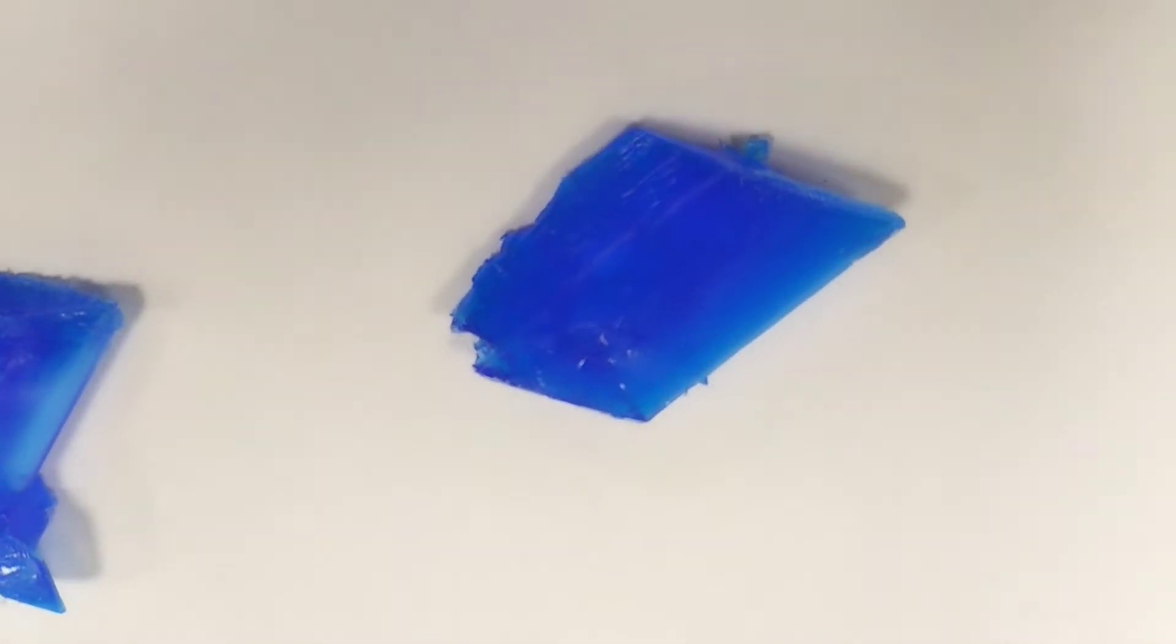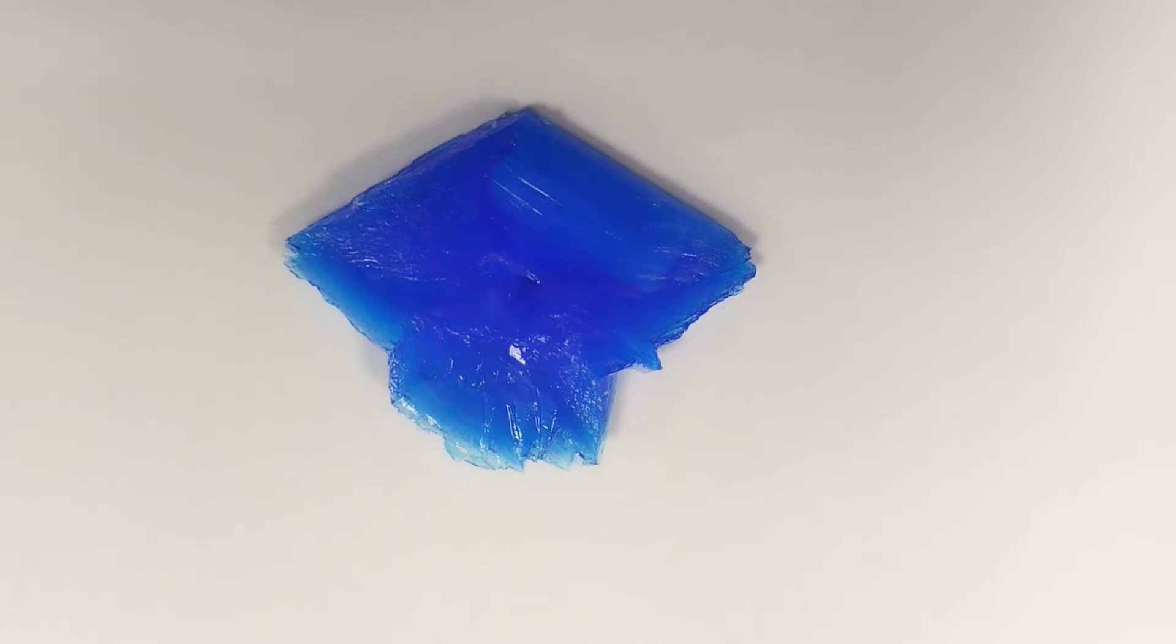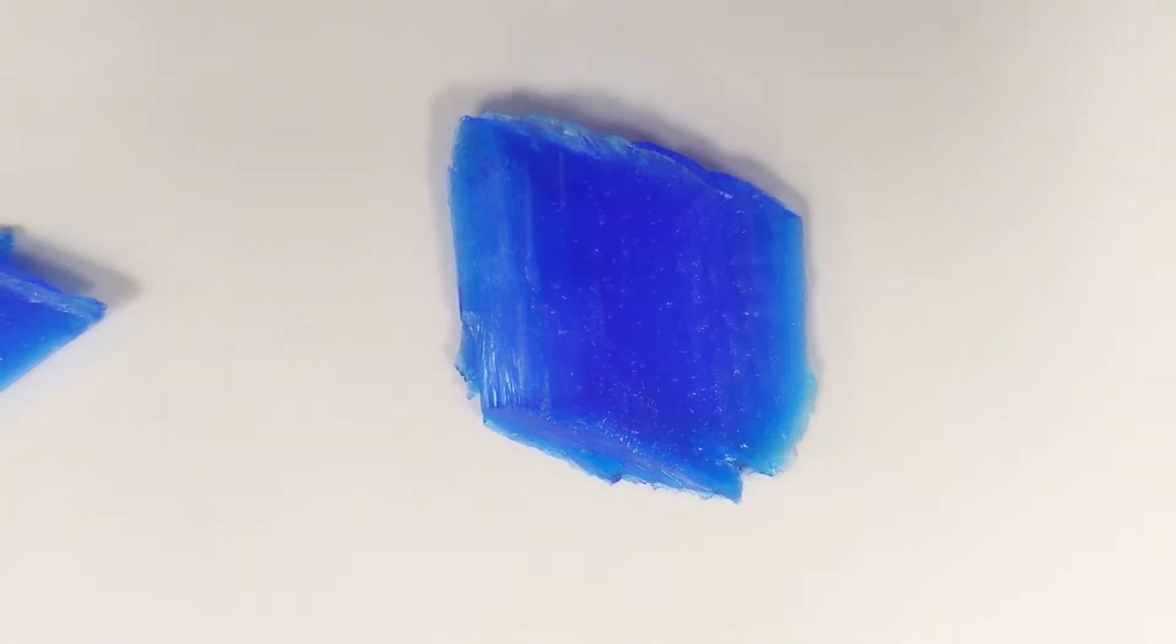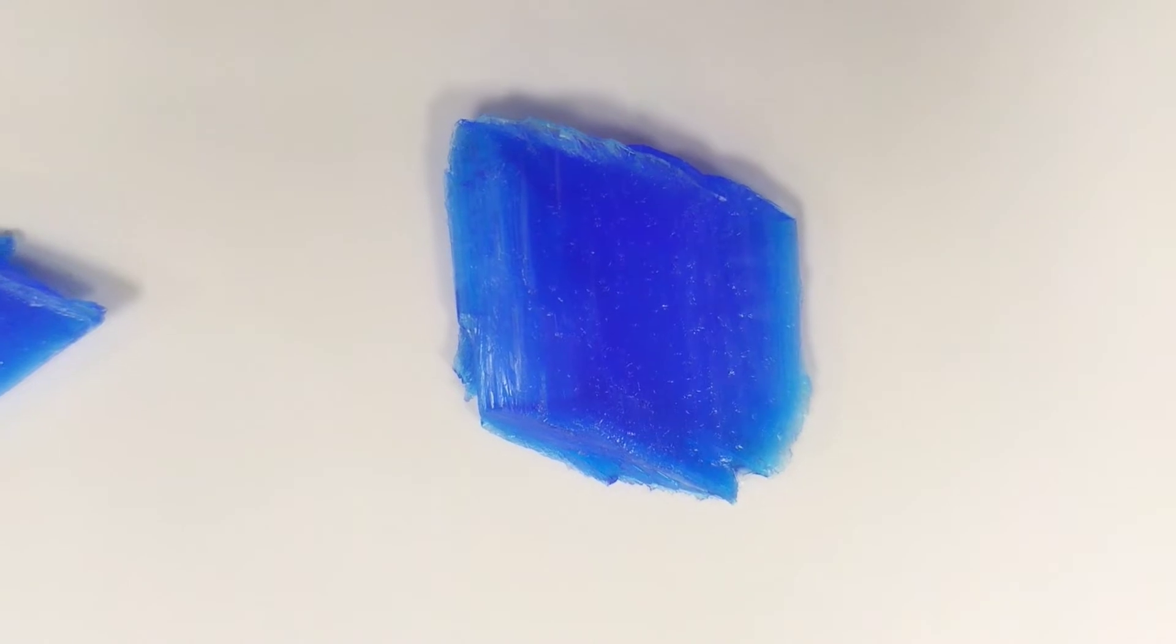This video is one week later. You can see quite significant growth of both of our original crystals, and I've been growing a couple more just for good measure. I'll keep growing these for the next few weeks and maybe even months to see just how large we can grow these copper sulfate crystals. Very exciting.